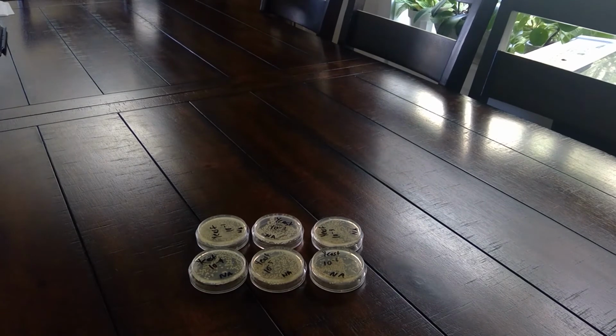So now we're at step 26. Count the number of colonies on each plate. Plates with more than 300 are considered too numerous to count, and plates with fewer than 30 colonies are considered too few to count. So plates with 30 to 300 are considered countable or viable.